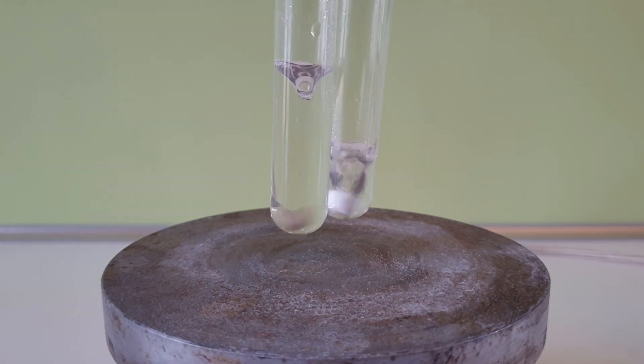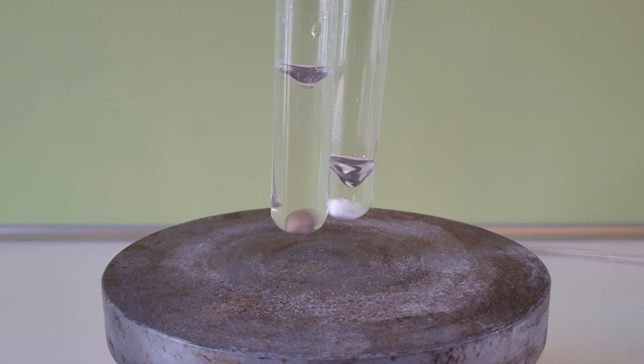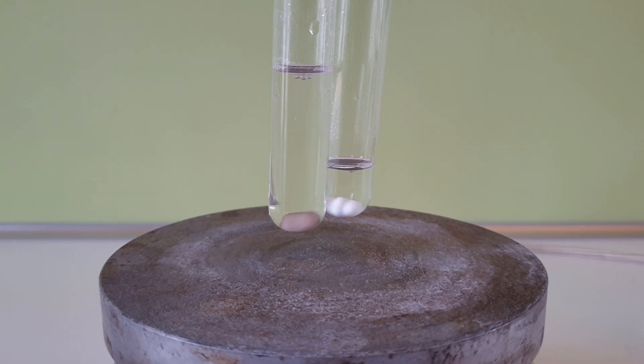Here are the two test tubes where all the carbonate reacted to the corresponding salts, and now it is time to remove all the water. Yeah, this might take a while.